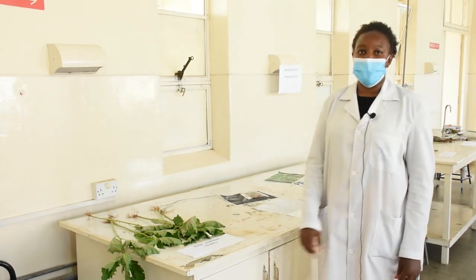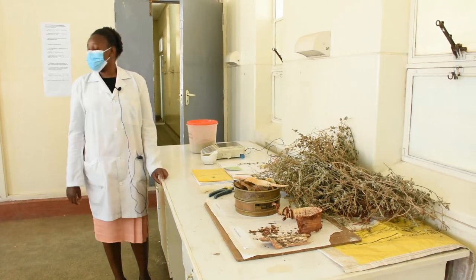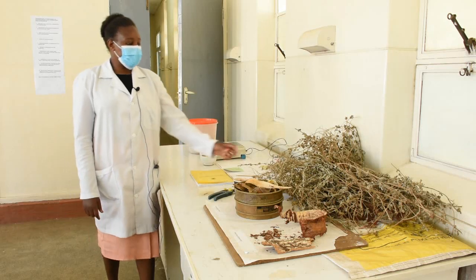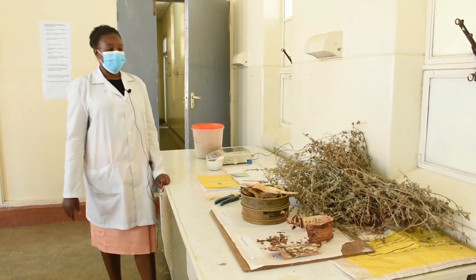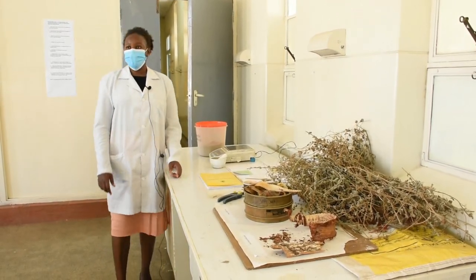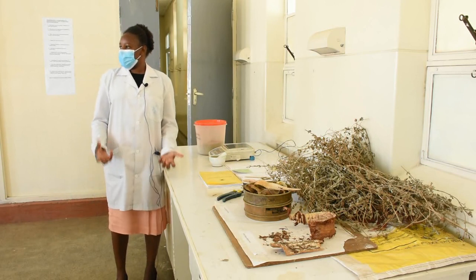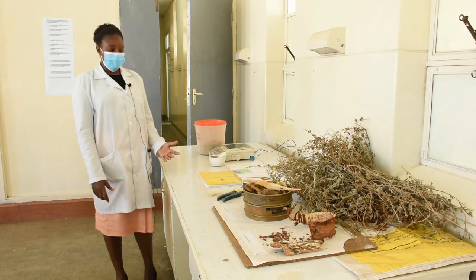That will be it for the poisonous plants. The next practical we are considering is extraction methods in pharmacognosy — where we get the phytoconstituents from the plant. The first step is plant collection, either from the wild or cultivated sources. Once you collect the plants, you press them between a hard surface using a plant press to reduce moisture content and prevent decaying or fungal growth of the specimen.